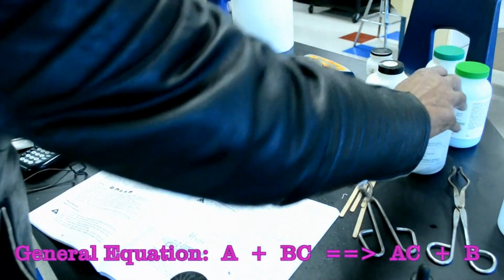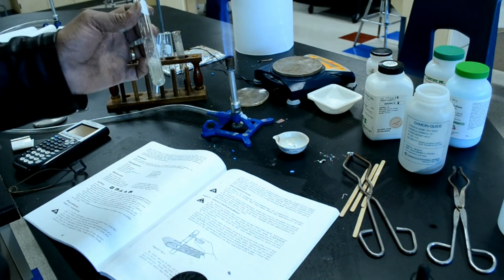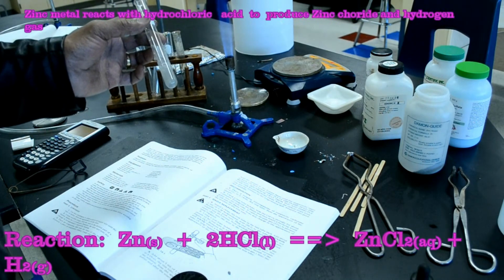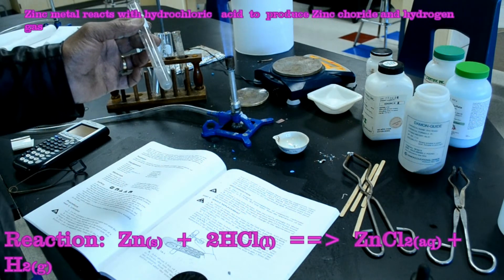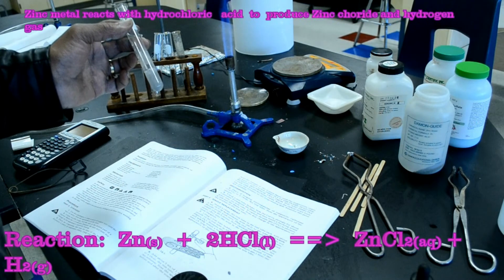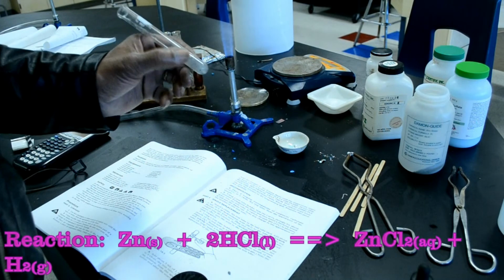Well, I put some zinc in it. You can see the zinc is actually bubbling. Now, it's bubbling because it's reacting with the hydrochloric acid. This is called a single replacement reaction. The bubbles that you see here are actually hydrogen gas formed when the zinc reacts with the hydrochloric acid. So the result of this reaction is zinc chloride and H2, hydrogen gas. It's also an exothermic reaction because the test tube is actually getting warm.